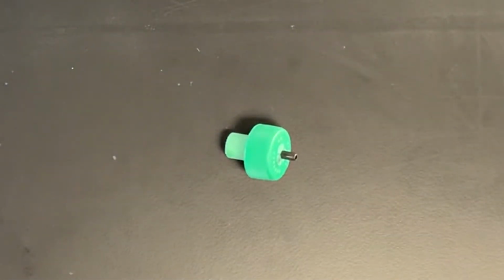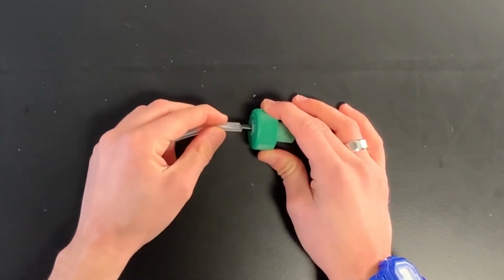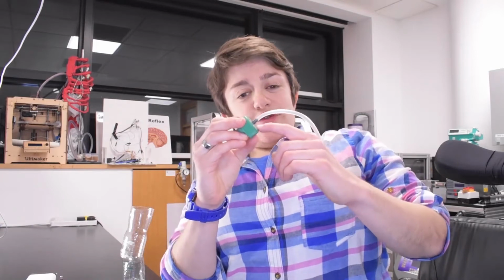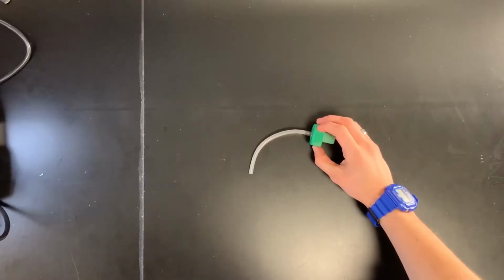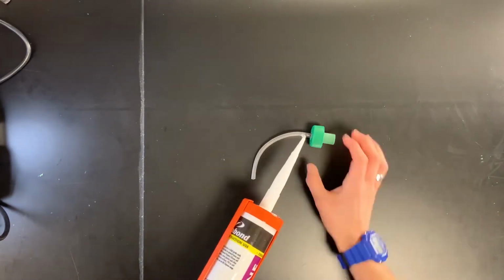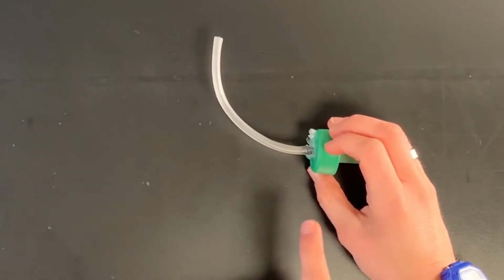Boom. Done. Now the next thing that we have to do is take a small piece of rubber tubing and fit it on over here like this until it's nice and tight. Next, we need to make sure that this joint here is watertight. So to do that, we're going to use some silicone. So what we're going to do is apply a silicone in a ring all around the outside here. Next, we're going to leave this to cure for 12 hours.